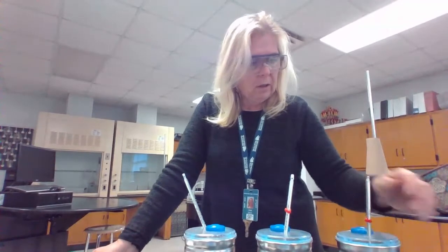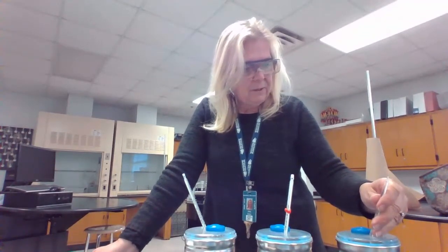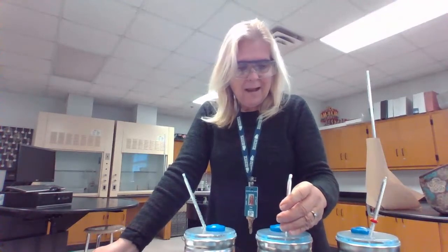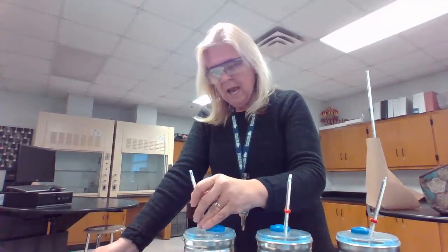Okay, we're going to give it a few minutes, and then we're going to come back and check. Okay, so our aluminum reached a highest temperature of 26 degrees Celsius. Brass reached a highest temperature of 23 degrees Celsius, and copper reached a highest temperature of 29 degrees Celsius.